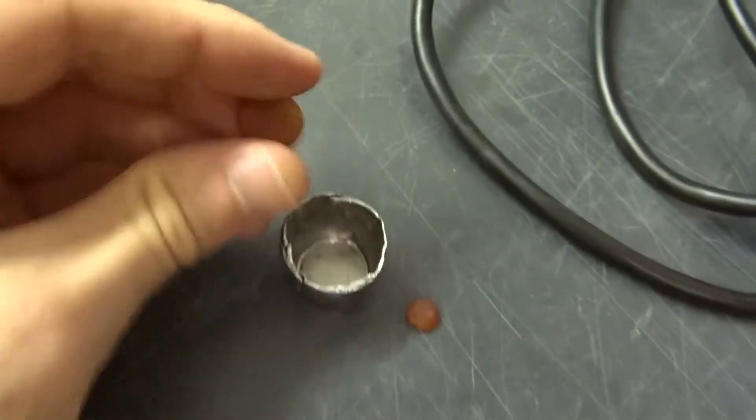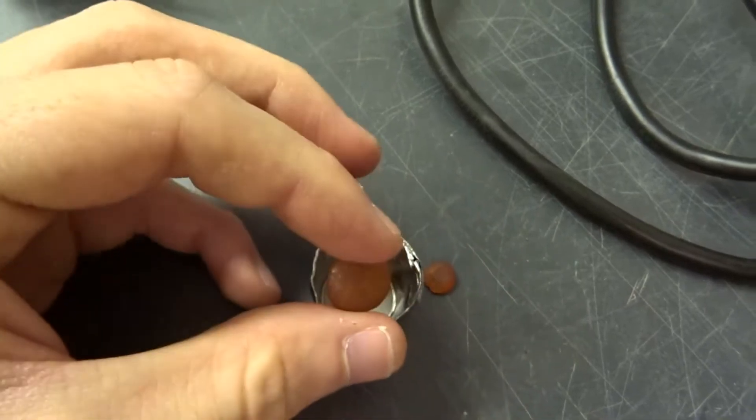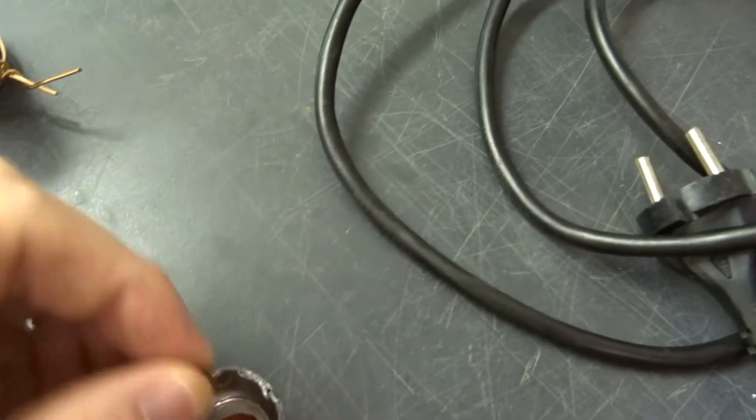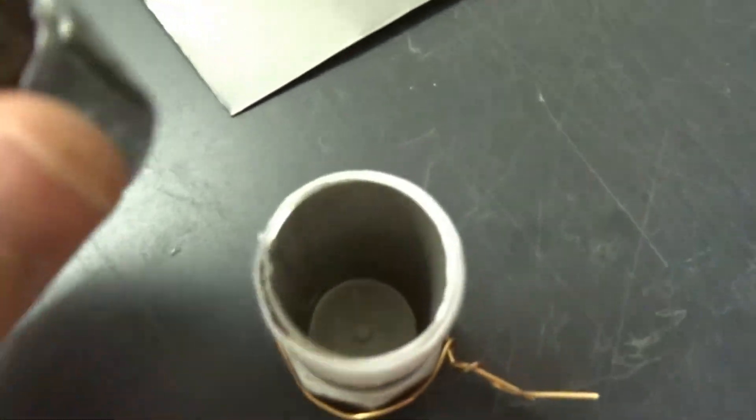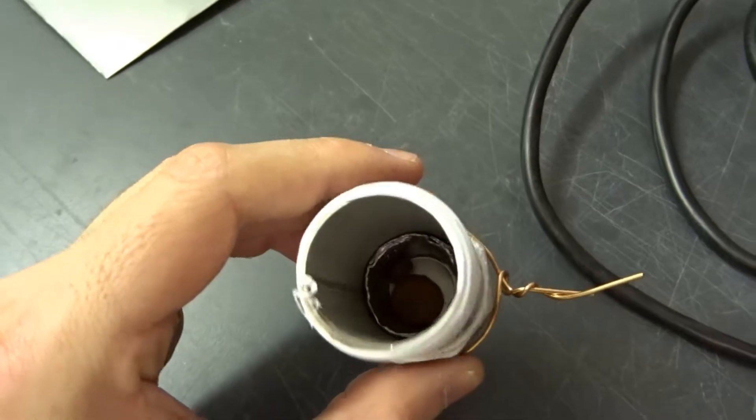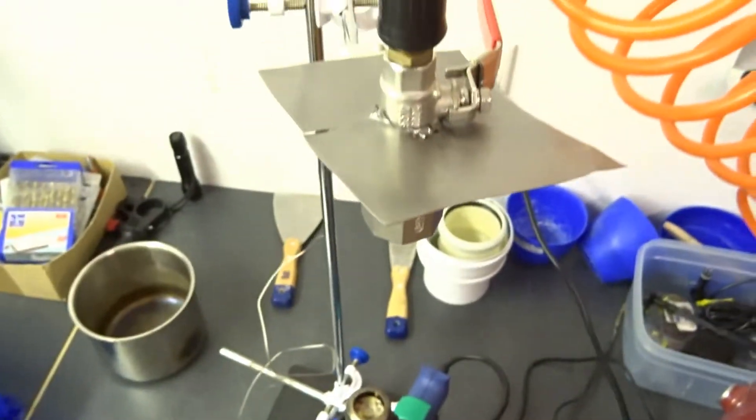So I'm going to load up the sample bucket and put this into the stainless steel container which is sealed at the bottom. And that's the setup.